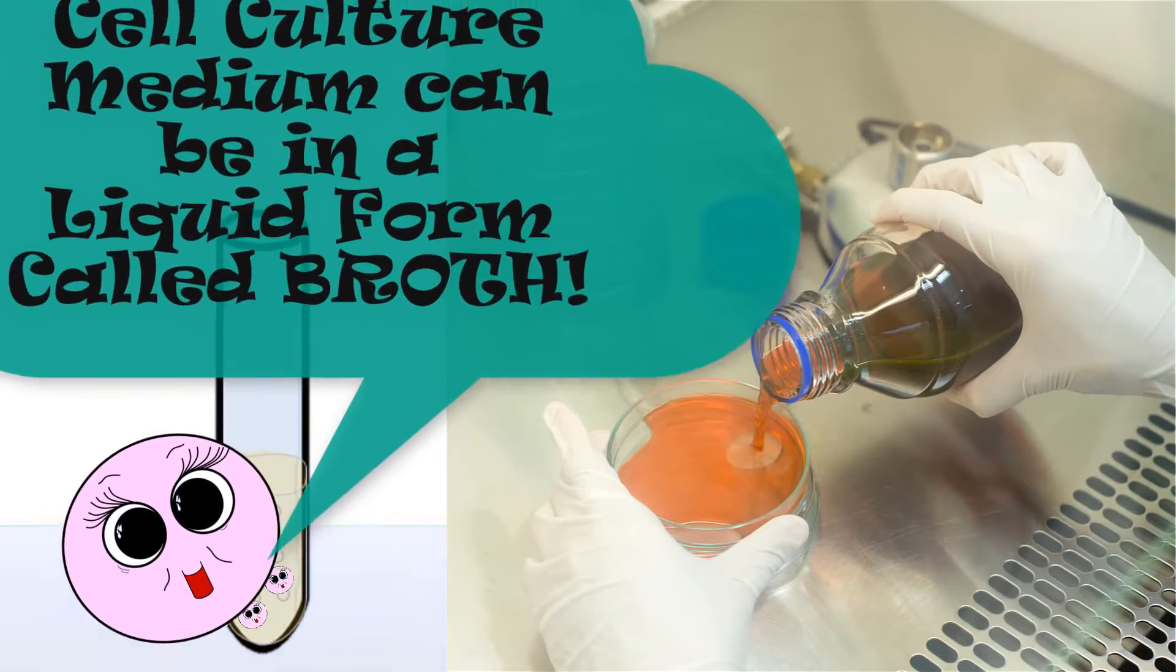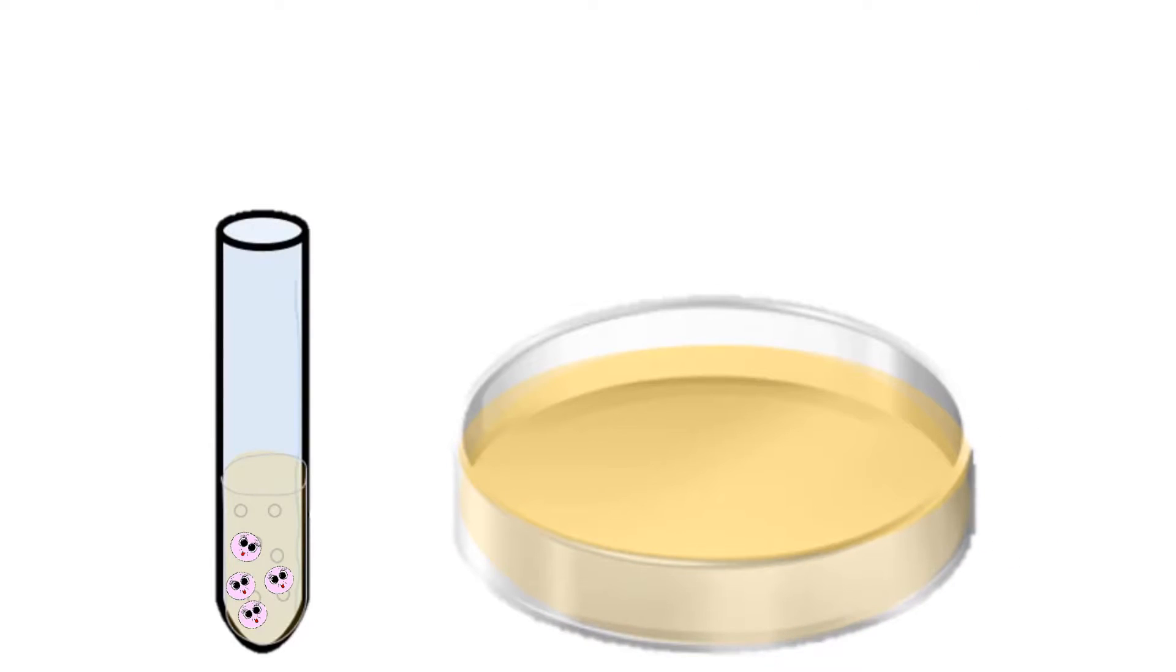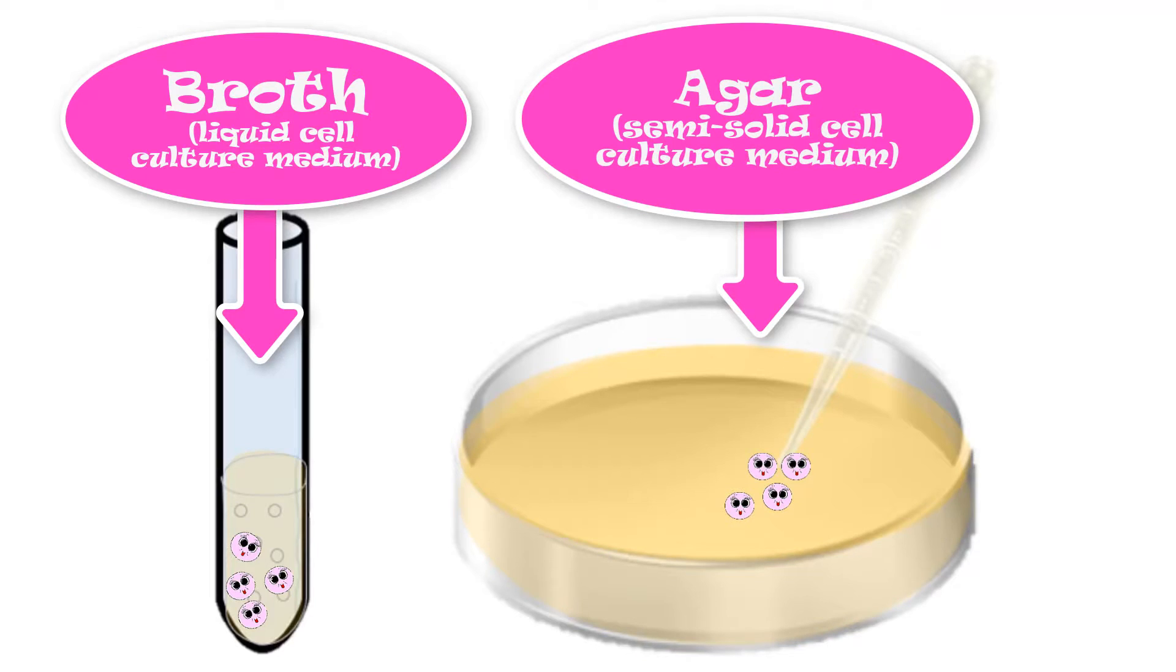The medium can be in a liquid form called broth, or in a somewhat solid, gelatinous form called agar.